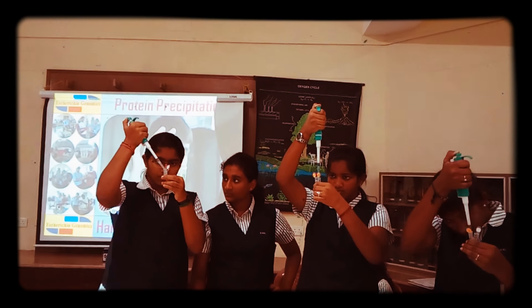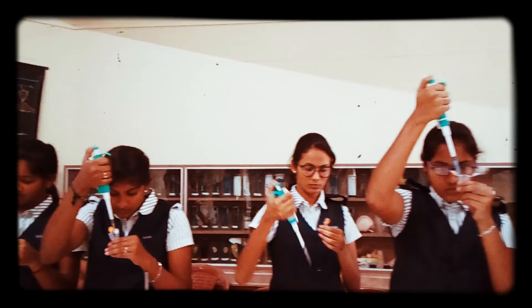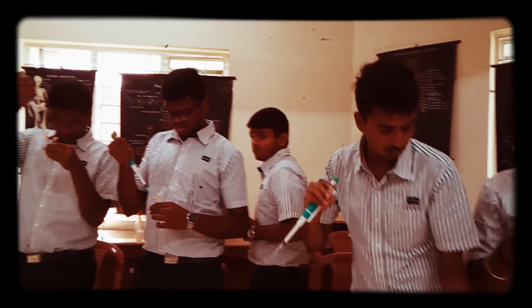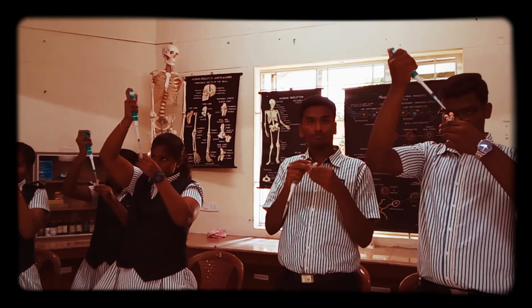Without disturbing the small hair line inside the middle of the liquid, drop by drop, part by part, you have to shift it and transfer it. Open the tube — take two tubes together, one blank and one filled. Then drop by drop, shift the liquid into the new tube up to nose height. Up to nose height — that is the perfect way.